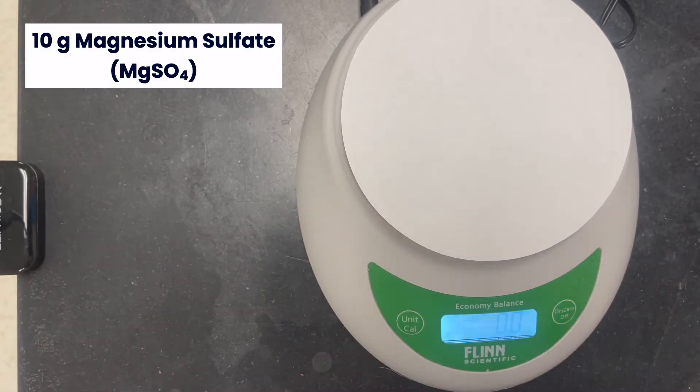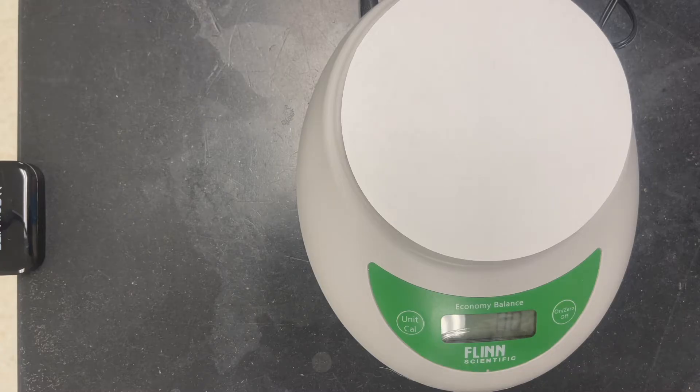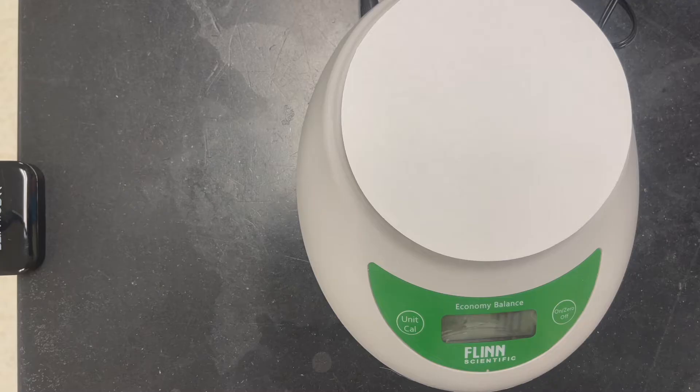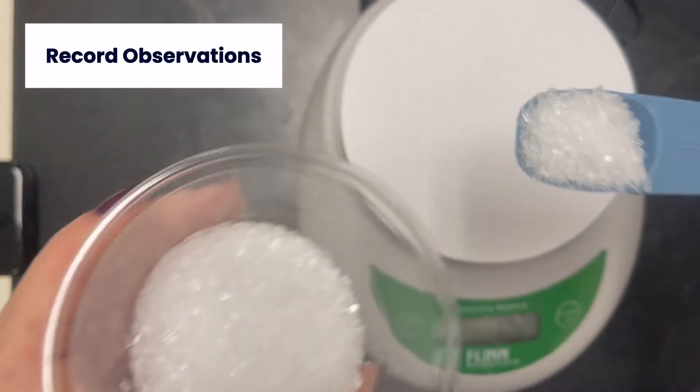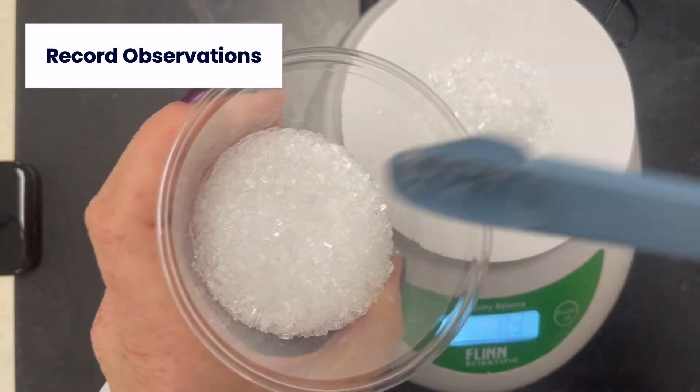Next, you'll need 10 grams of Magnesium Sulfate. Record your observations. What does Magnesium Sulfate look like?